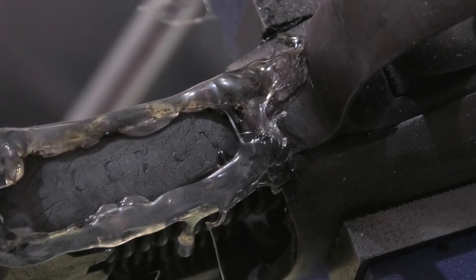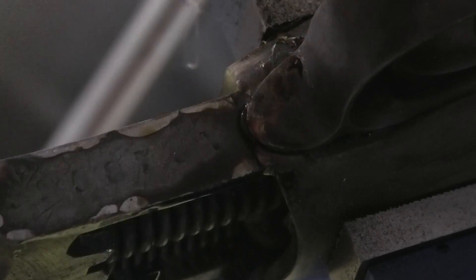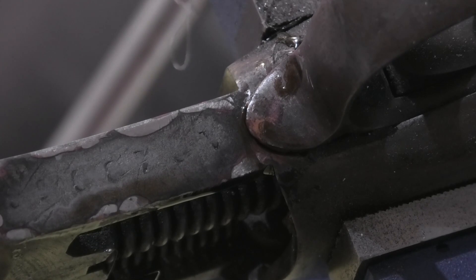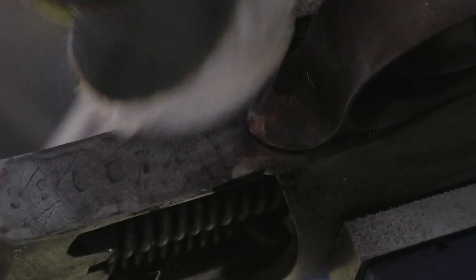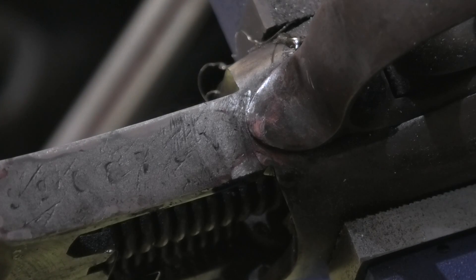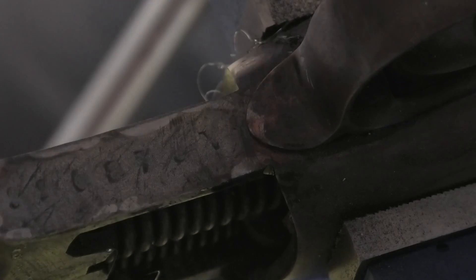I'm not going to bore everyone with the entire process right here. It's a lot easier for me to see in front of me than on the screen, but those numbers are getting pretty legible again. I probably did about seven or eight different layers of Fries reagent with a couple of nitric acid rounds. You can see that what was totally shaved off is kind of being restored now. Let me just do one more swab and see what we can bring out to finish off the day.